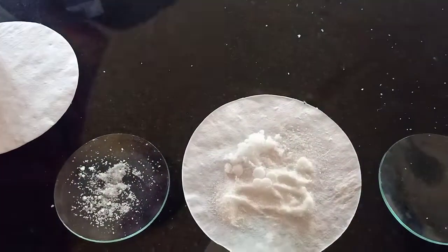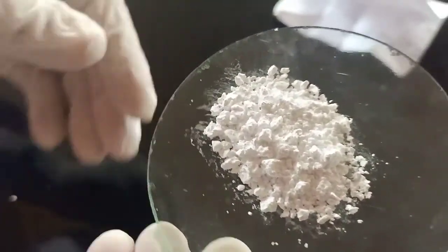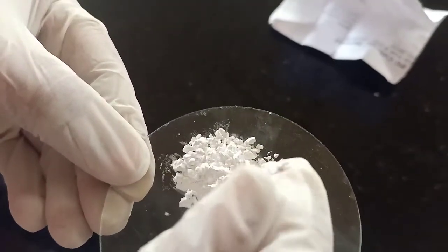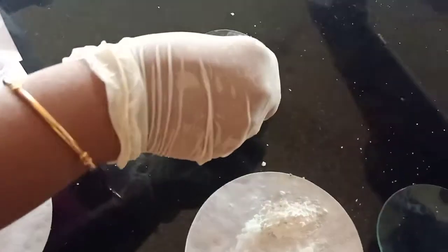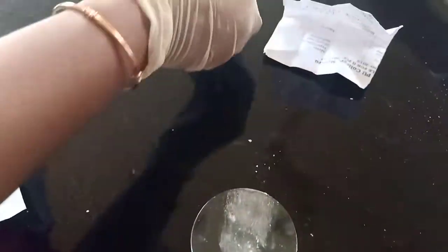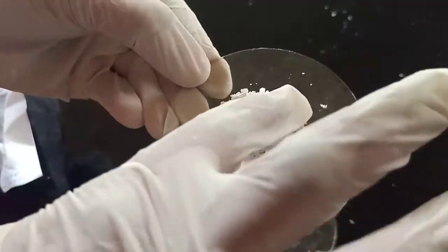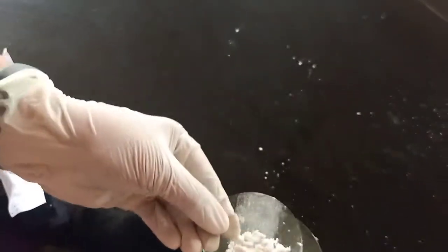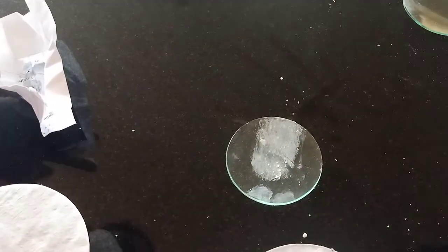This is calcium carbonate. See — this is also just like chalk powder. If the carbonate is there, it will be like chalk piece powder. Calcium carbonate. Next is calcium sulfate. See here — this is also white in color. Calcium sulfate is just like calcium carbonate. It is very difficult to find the difference between calcium carbonate and calcium sulfate — they are similar.